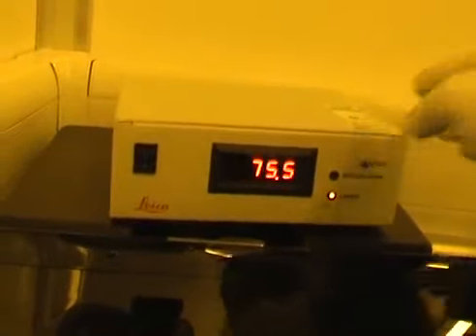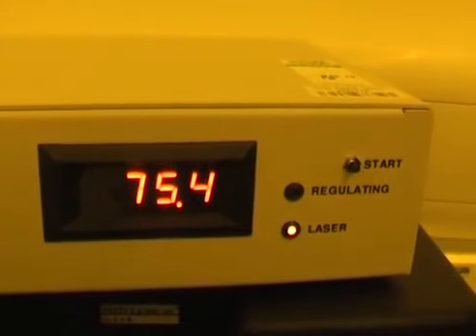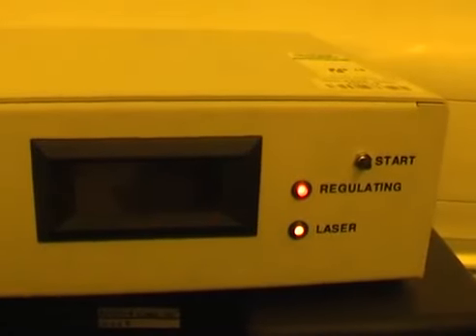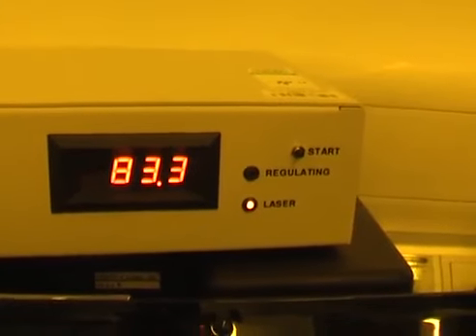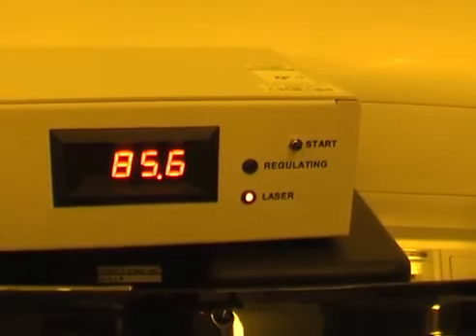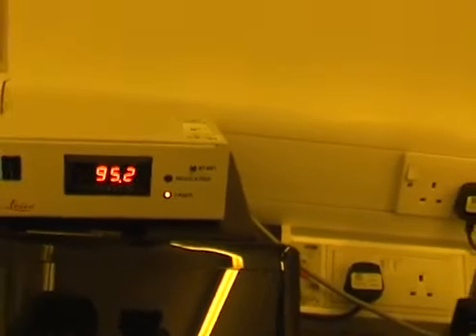So, laser spot on the sample, switch the regulator on. Let's move in the X direction and see what happens. It's the Y direction, oops, sorry. So that direction is Y, it's fine. X goes from 96 to about 60. Still roughly the same tilt, nothing I can do.